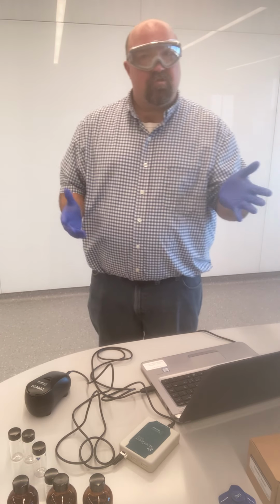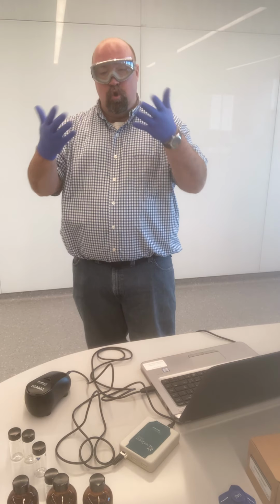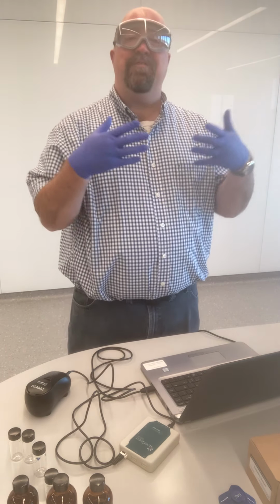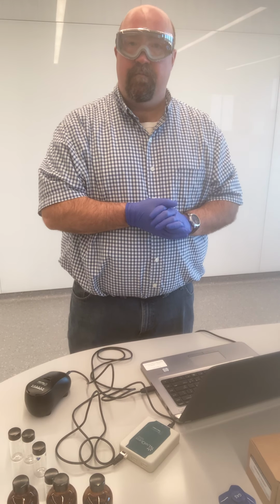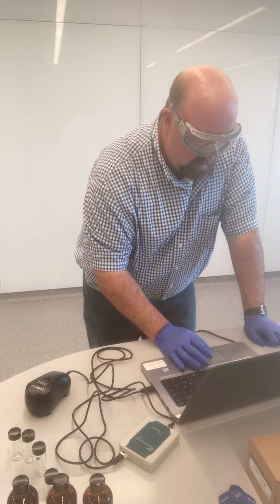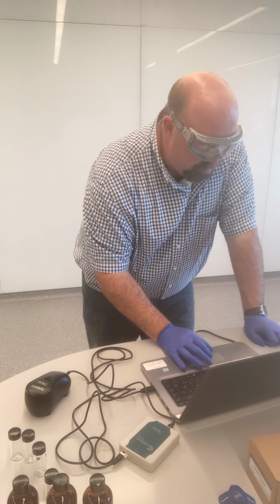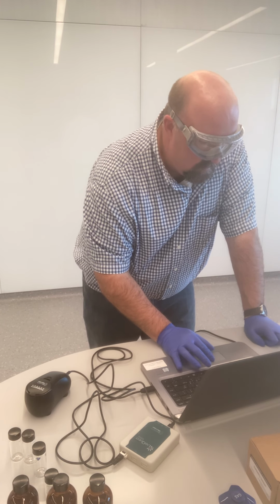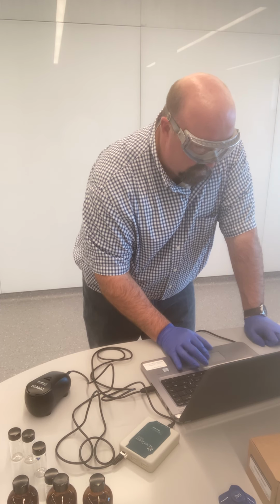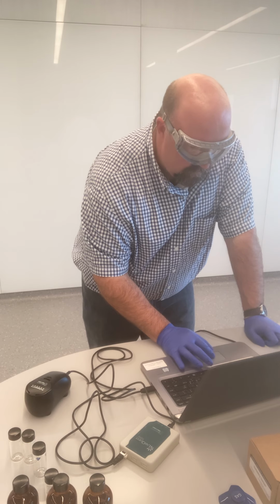And with that information, another 114 student could duplicate that portion of the experiment if they wanted to. And so that's the level of detail that you need to be thinking of in your notebooks. And so I'm going to go ahead and go through that now. I'm going to calibrate the turbidity sensor. And I'll show you just some of the things that I do as I am doing this.